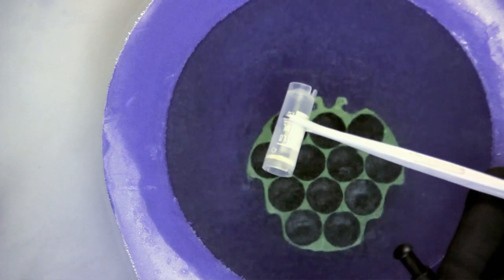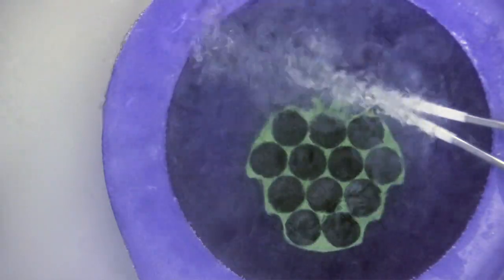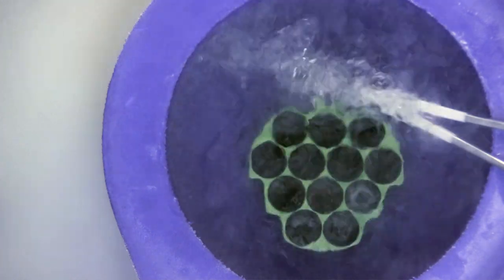Standard cryo vials can also be used to load samples. This is my preferred method since I find vials easier to handle and the samples are in liquid nitrogen the whole time.